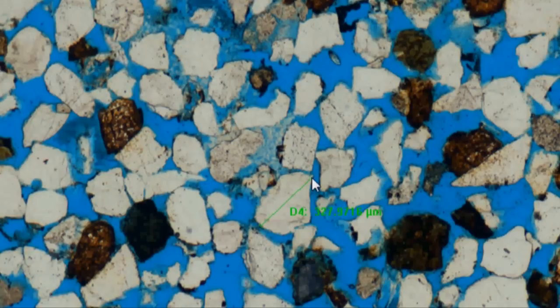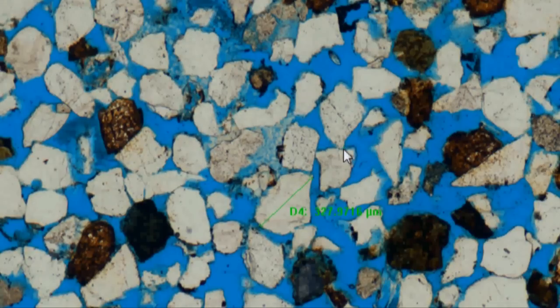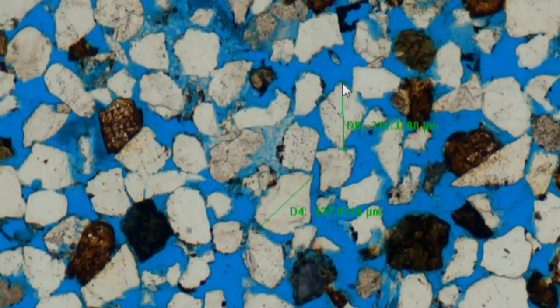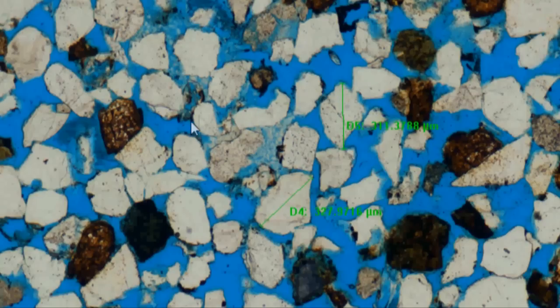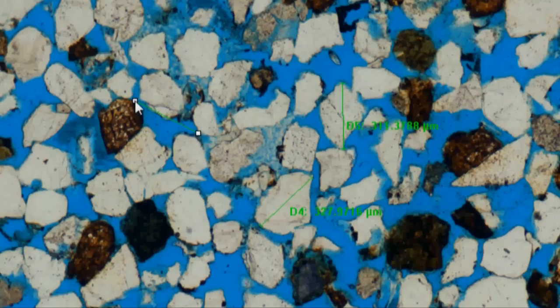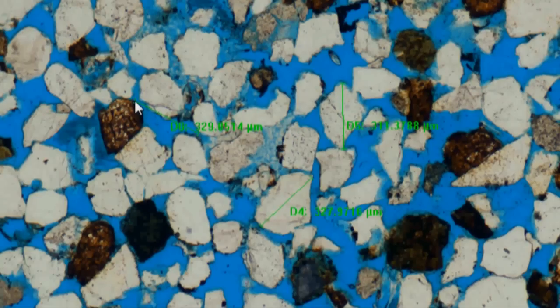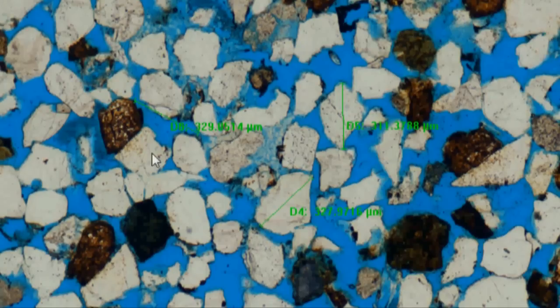The images retain the finely calibrated pixel-to-micron conversion data to allow the user to accurately measure objects on screen, as shown here with measurements of the long axis of a couple of grains and a pore space.